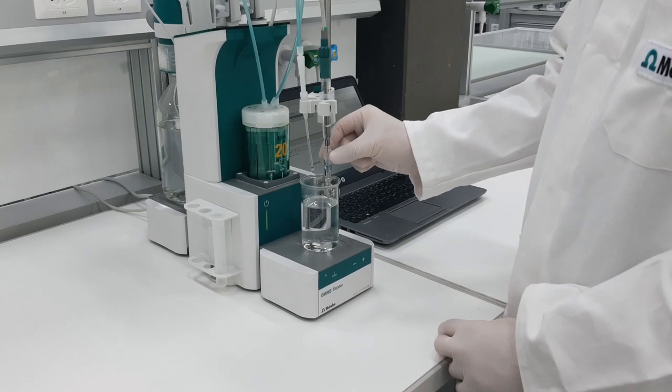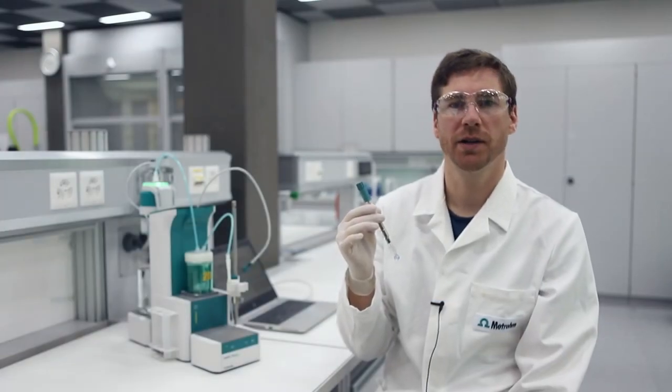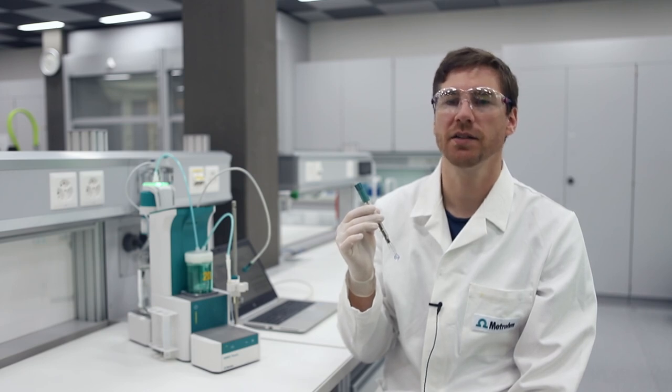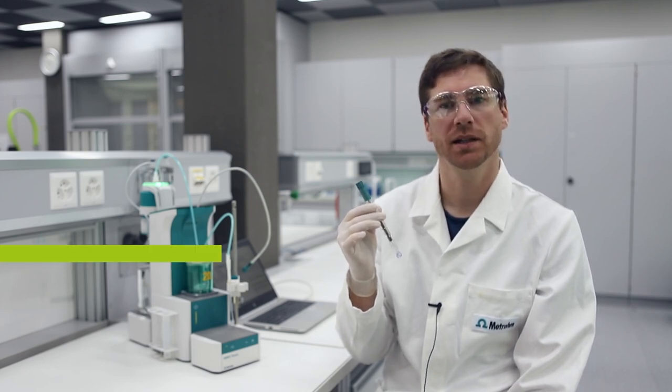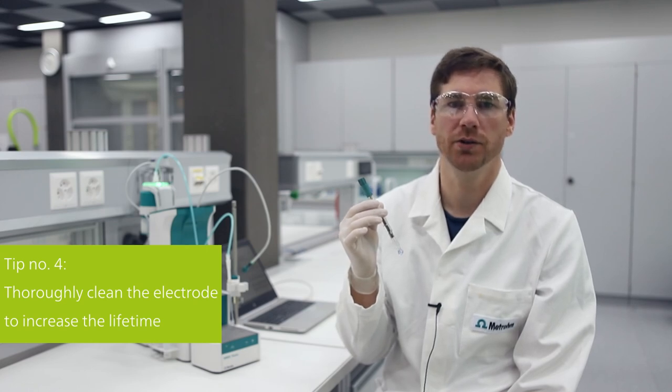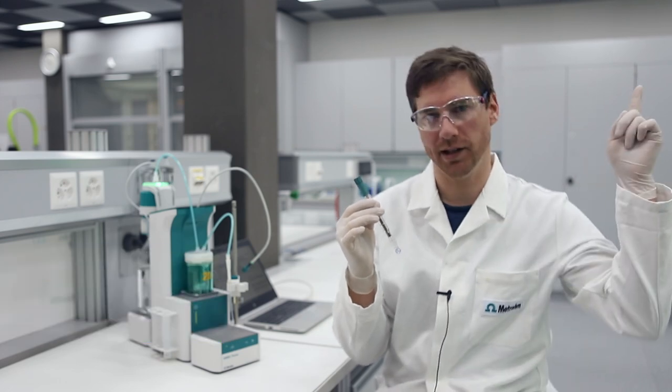Finally, is there a way to make sure your electrode enjoys a long life? Yes, there is, and this is my tip number four: clean your electrode thoroughly at regular intervals. How often you should do this depends on the type and number of samples you analyze. Click on the link to watch a video that shows you step by step how this is done.